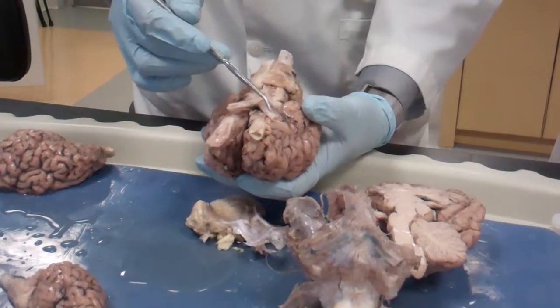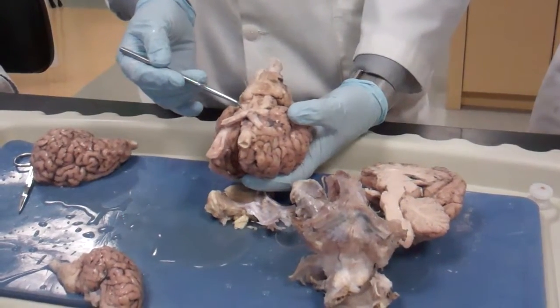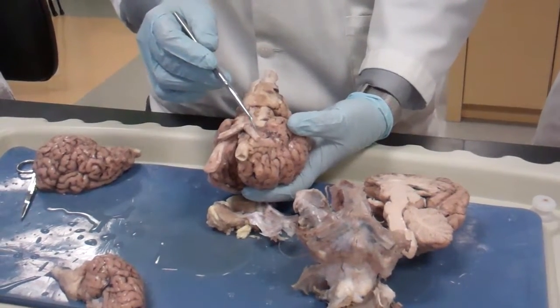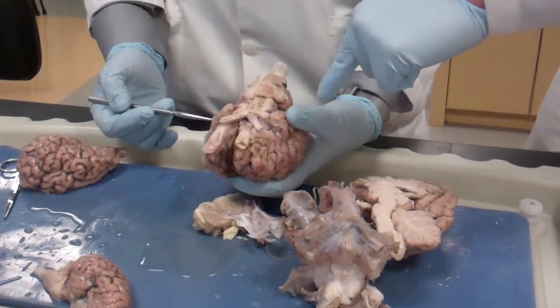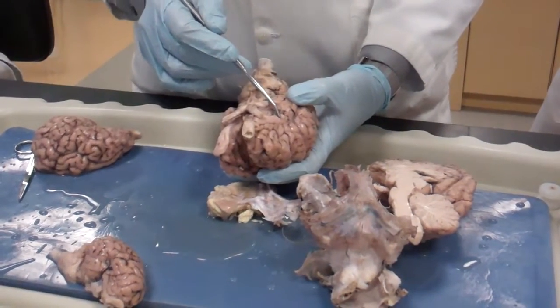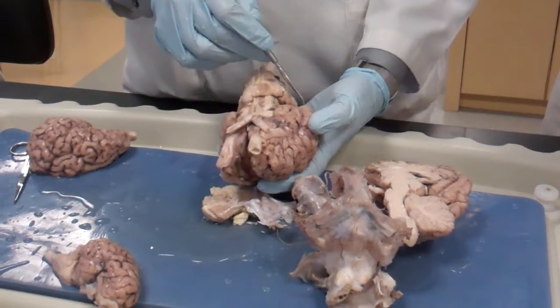We have the optic nerve — number two — and then it makes a criss-crossing. This is called the optic chiasm. It continues to make up the optic tract, but it's not made of the same fibers. Half the fibers come from this side and half the fibers come from the other side. Olfactory and auditory go to the temporal lobe, so olfaction and hearing go to the temporal lobe.